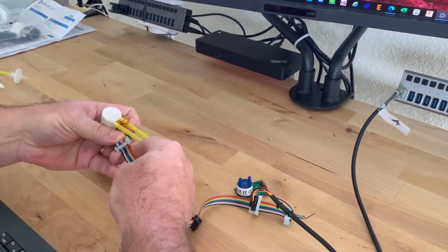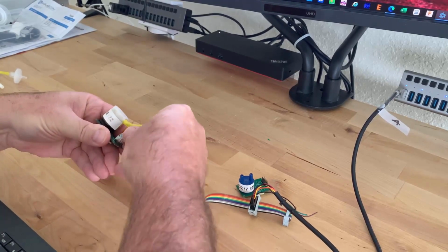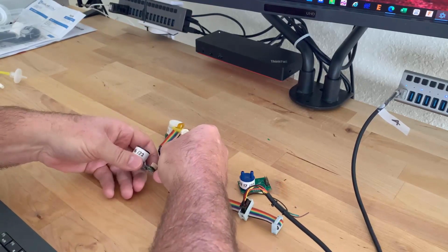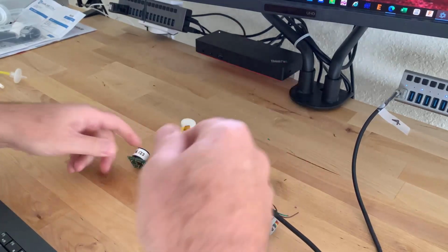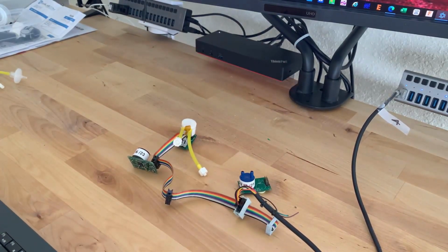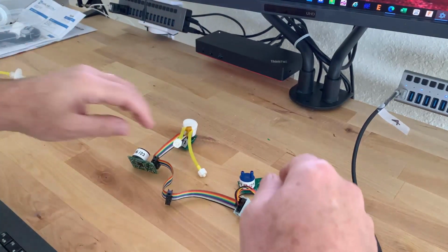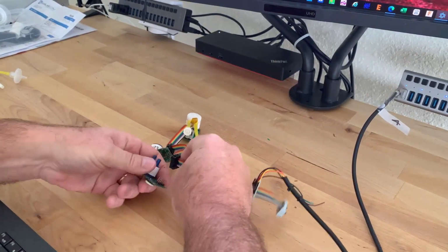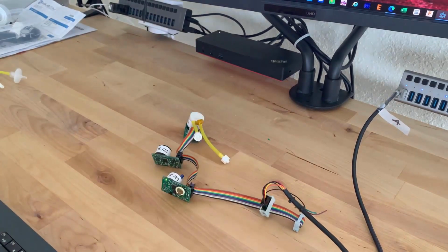I'll start off here with the one with a tube cap on it. And this is just simple 10-way flat ribbon cable. You can run it as long as you want to. You could use discrete wire if you'd like. I have one of those right here, not quite as pretty, but certainly functional. And there we are. We have three sensors connected.